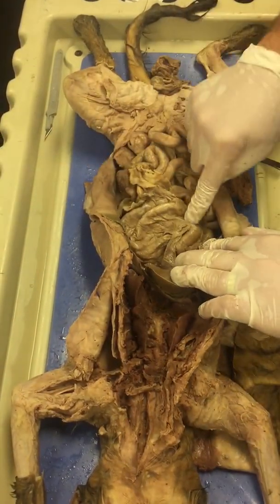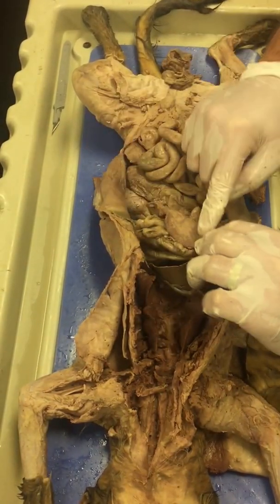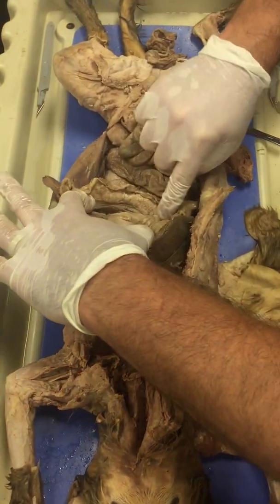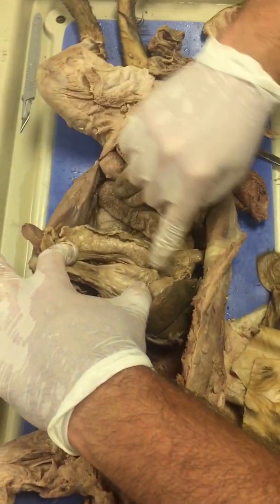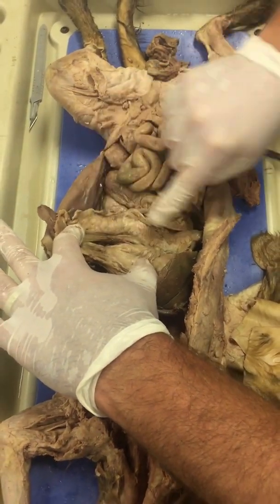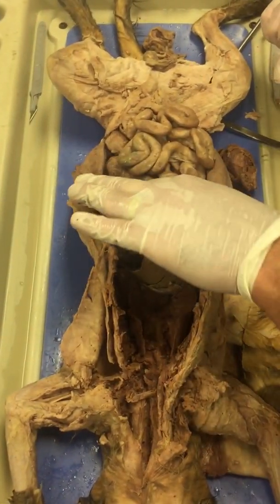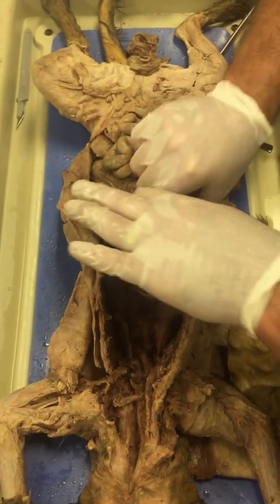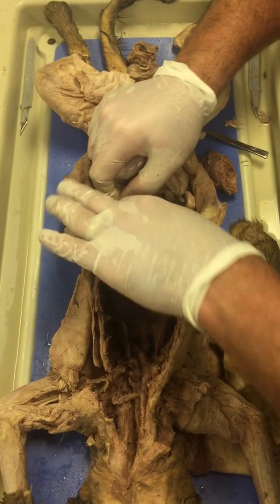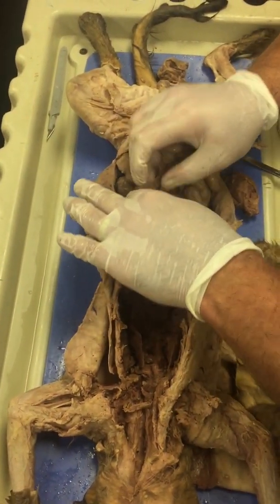Okay, so underneath the stomach, between the stomach and the spleen, which is right here, you can see this structure right here. Anybody know what that is? That's the pancreas. It kind of looks like chewed up gum. Right there. Okay. Here's some more of it. So it goes here and here. Runs kind of behind the stomach and kind of along the first section of the small intestine, the duodenum here.